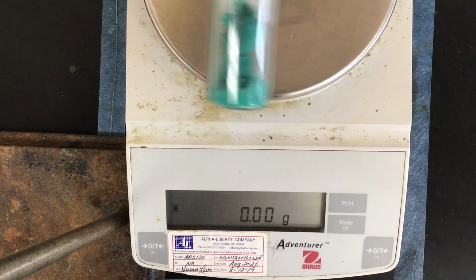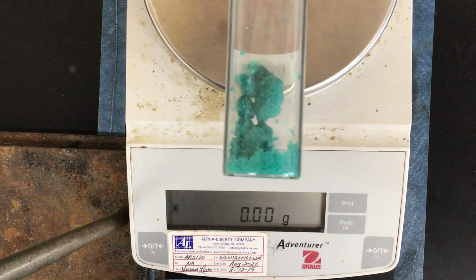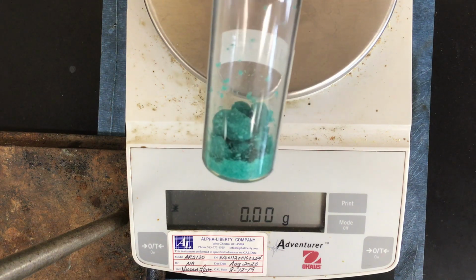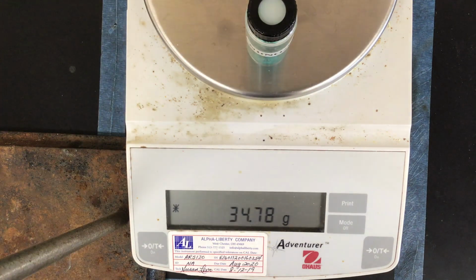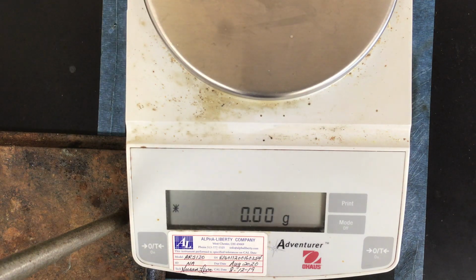And then I'll turn it around here so you can get a good look at what the sample's physical appearance looks like, because you'll need to record some information about that as well. And I'm going to go ahead and put it on the balance so you can record the mass of that sample. You can pause this video as needed or rewind it if you need more time to write these things down or make observations.